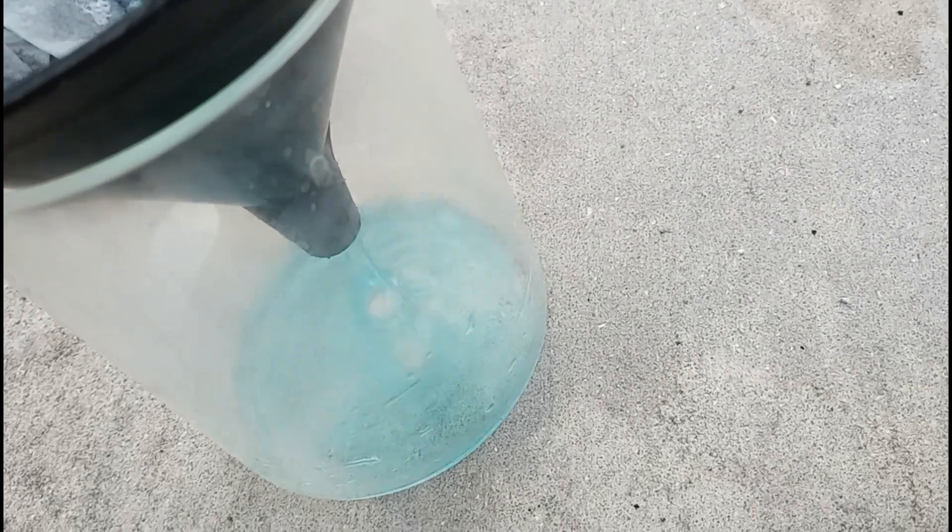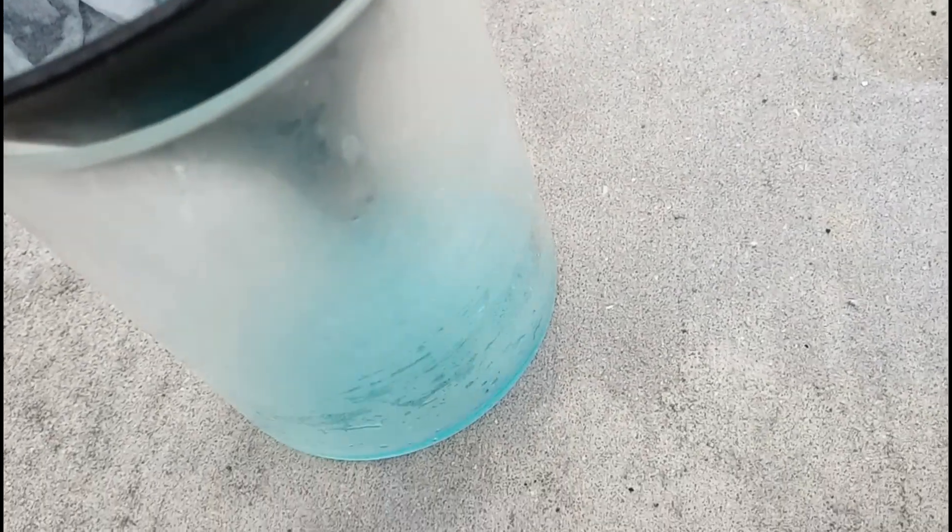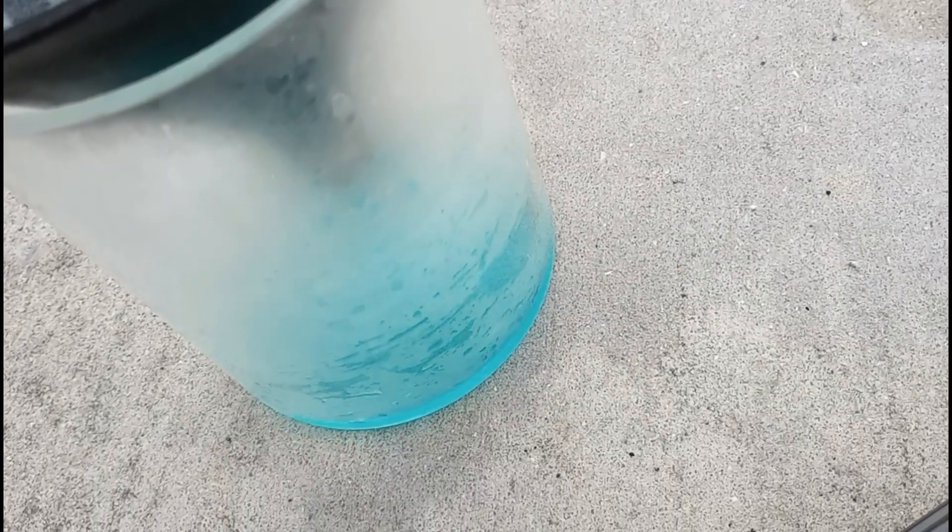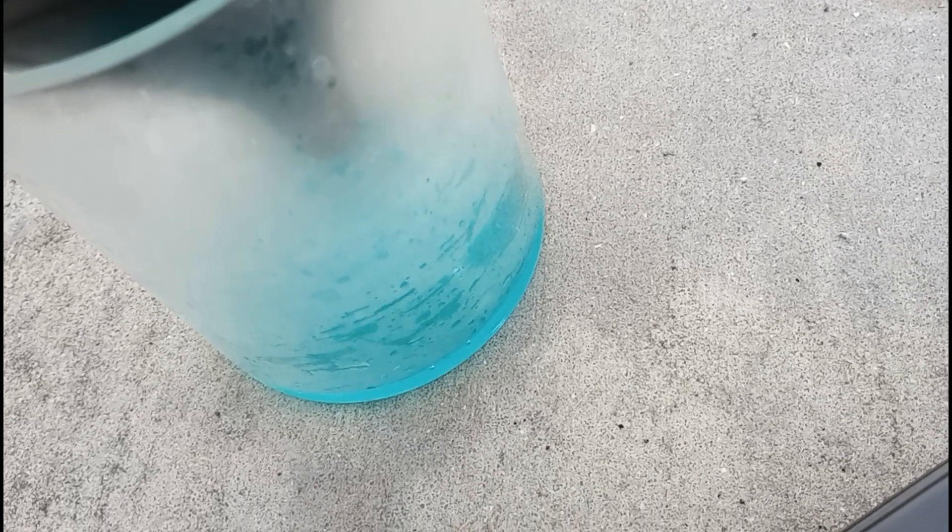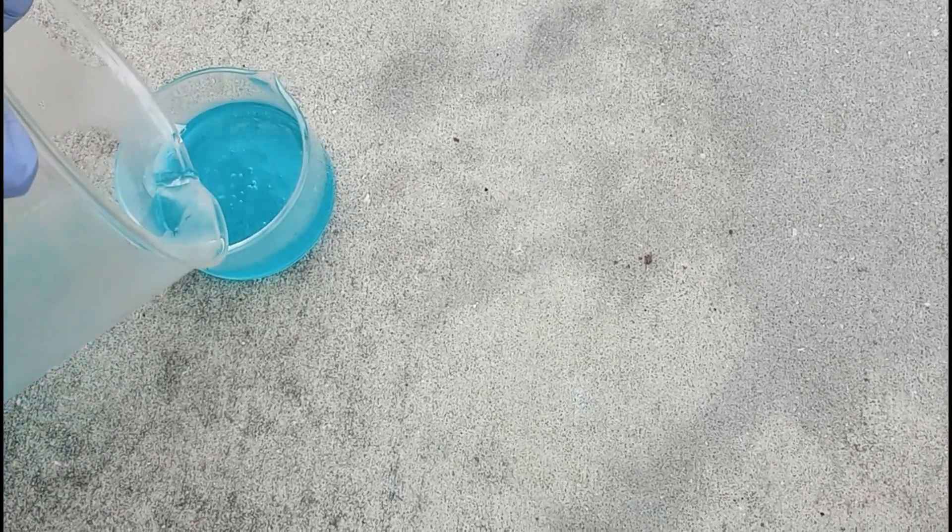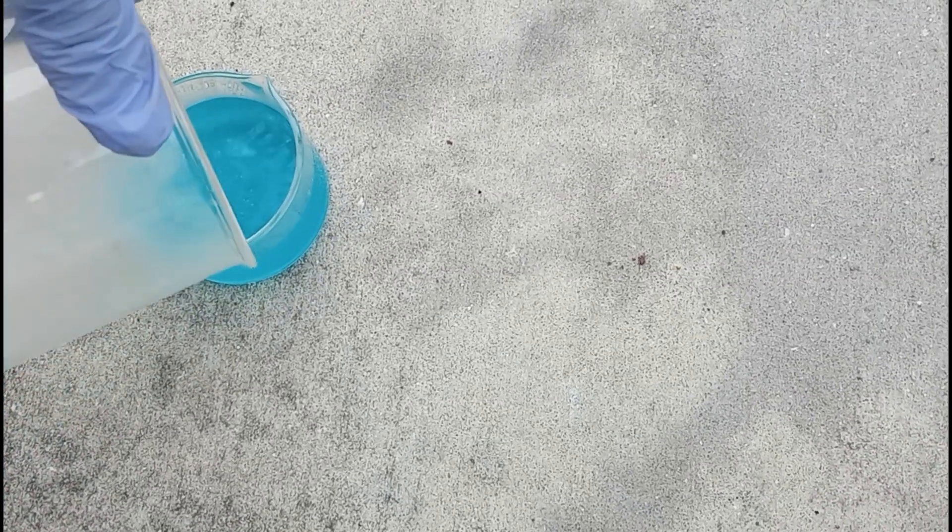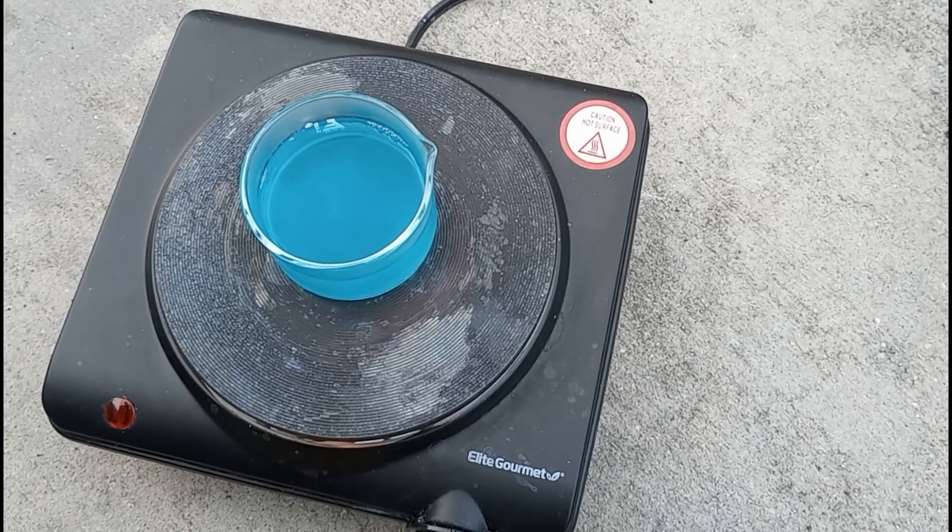I ran it through a funnel with a paper filter, and then transferred what was left into the evaporation dish. And, of course, back to the super scientific hotplate.